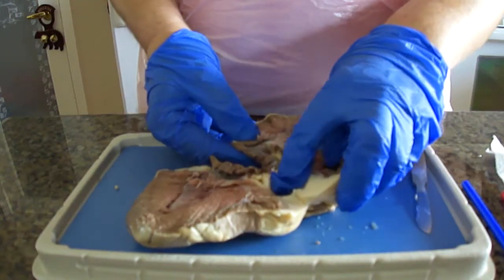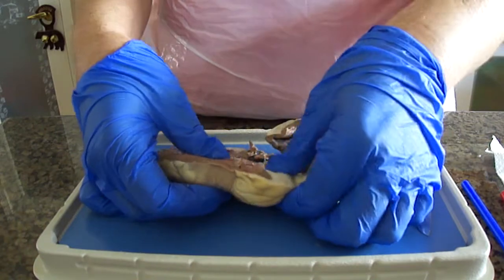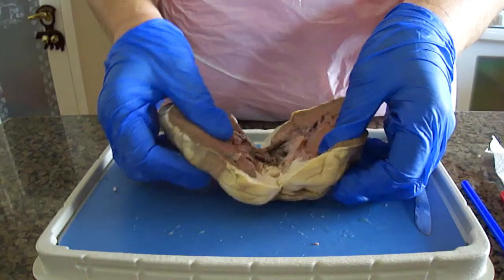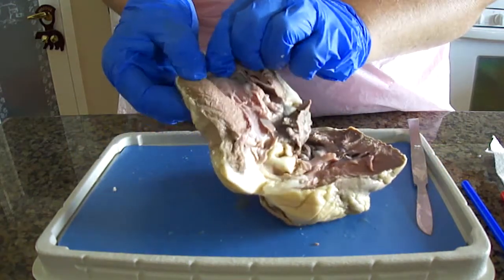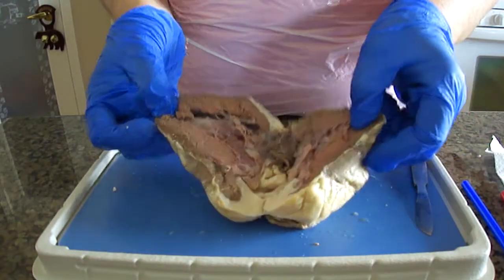The right ventricle, the chordae tendineae is going to be right in here, and the papillary muscles are also in the same area. The pulmonary valve is at the very center, and it is above the right ventricle. I don't know if we can even see it here.